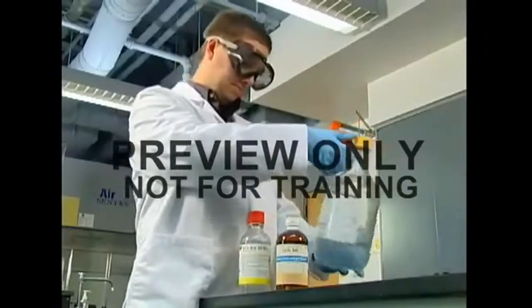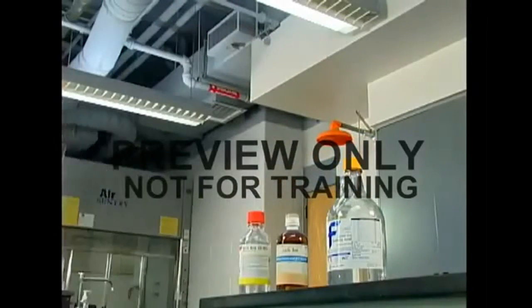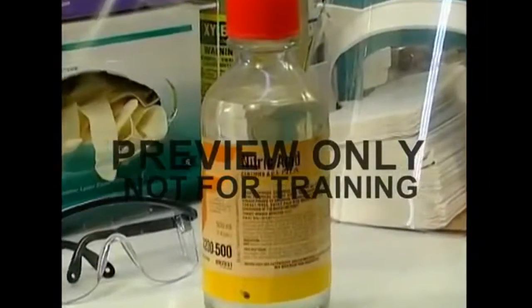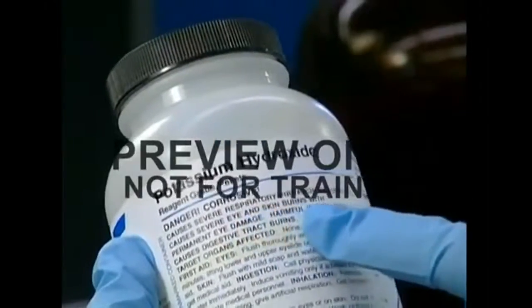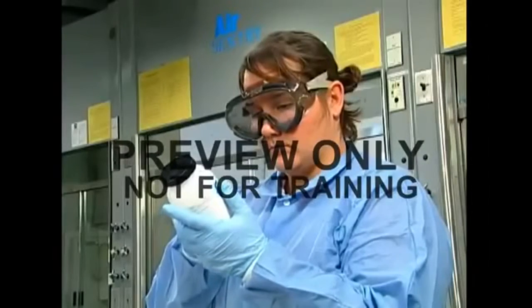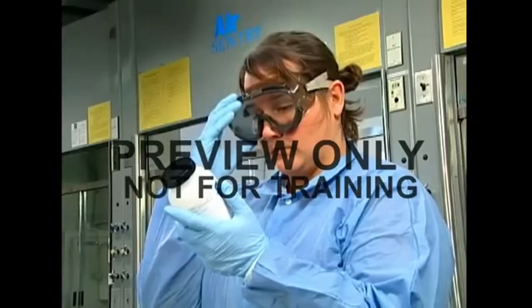Corrosives can be especially harmful. They can often cause severe damage to the skin and eyes. Corrosives include strong acids and bases and both dehydrating and oxidizing agents. Nitric acid, for instance, produces a slow-healing, painful burn. Potassium hydroxide, a base, can inflict severe damage to the eyes. Of course, when you're working with these types of substances, you should always wear personal protective equipment.